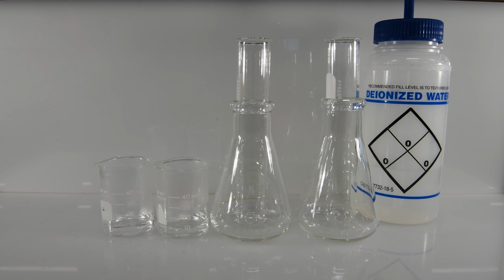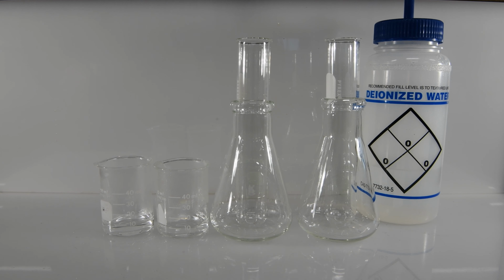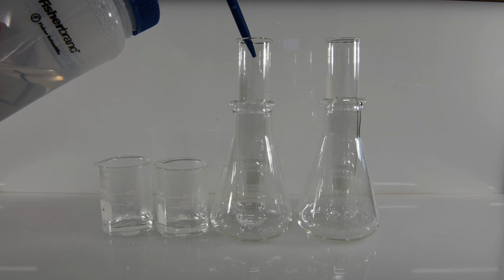There's two parts of this experiment. In the first part, we're going to simply be preparing solutions of the calcium chloride and magnesium chloride to use in part B. And the other goal is to determine what's more reactive, calcium or magnesium. So to do that, we're going to carry out a second experiment, but this time we're going to use water instead of hydrochloric acid. So let's go ahead and add some water to each of these two test tubes.